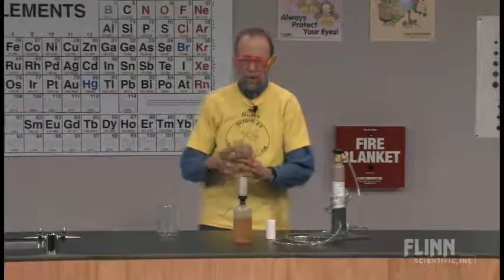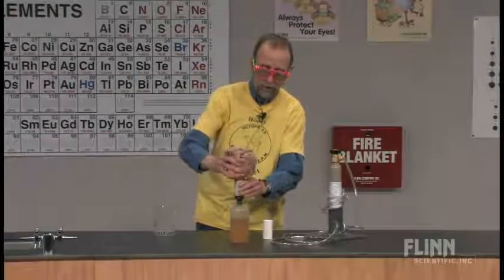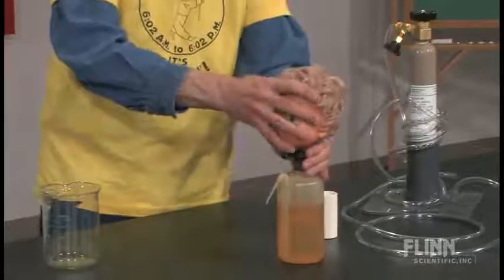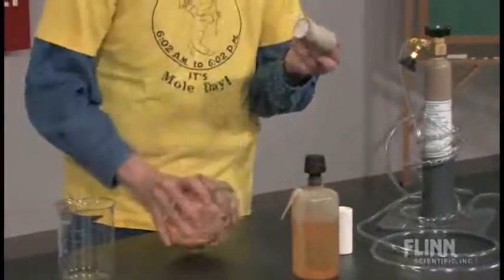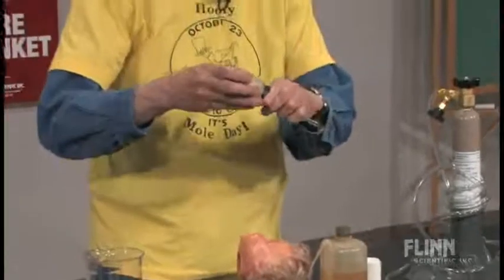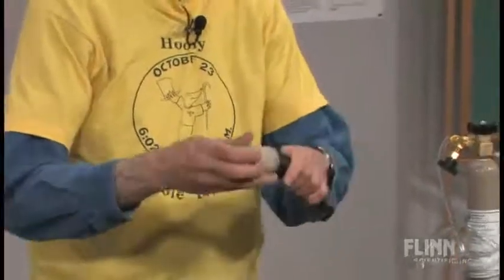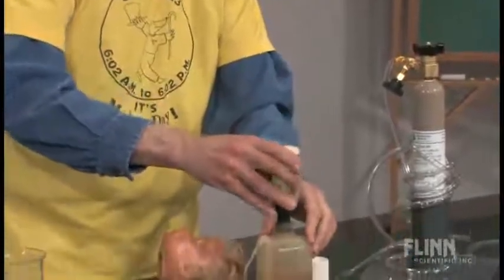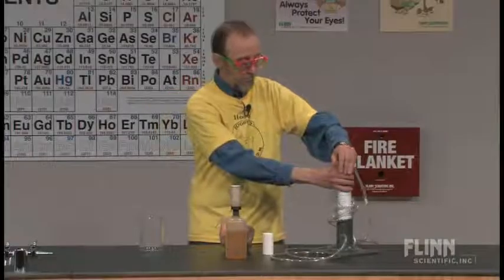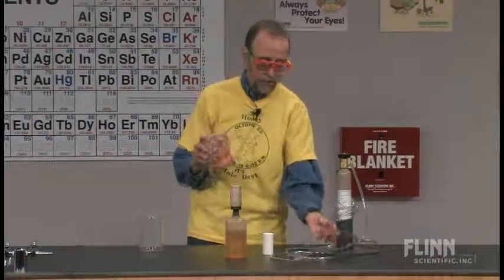But we're not going to do that. Instead, we're going to take this doll's head as our control and simply put it over the porous cup. You can do this with a beaker if you wish. What do you see happening? Nothing. This is a wash bottle — it's simply a couple of stoppers with an opening and a glass tube. I'm putting this on with, for lack of anything better, a yellow fluid. And here I have some hydrogen gas in a tank under pressure, and I'm going to fill this with hydrogen gas. Hydrogen gas, as you know, is less dense than air.